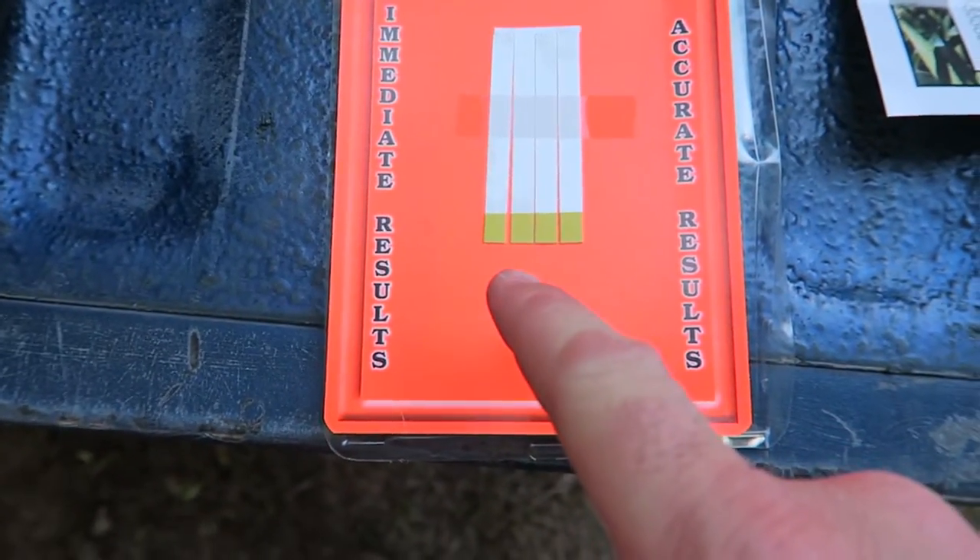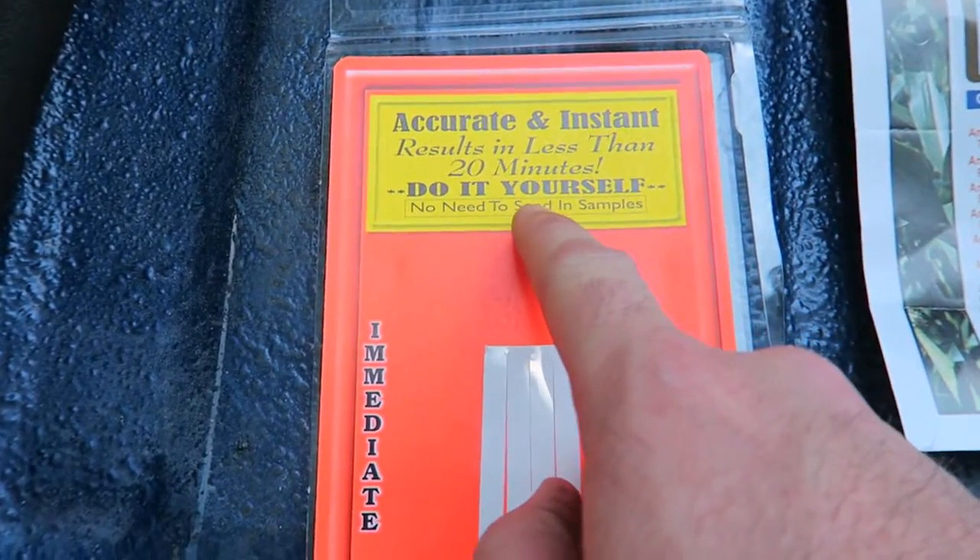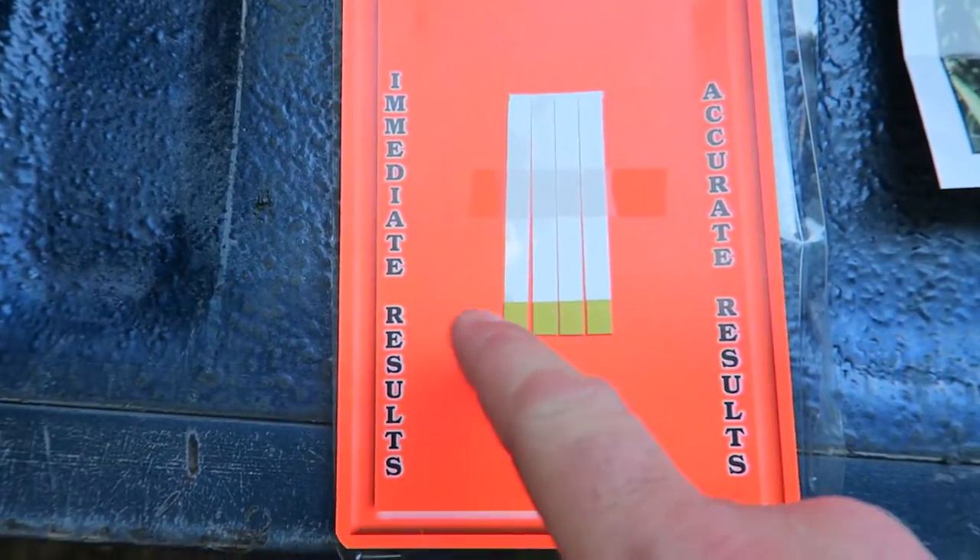This plot I tested back in February and it was 7.0, planted it and it turned out great. Then I had it tested again two to three weeks ago and it came back 6.9 — still perfect. So I'm going to run this test kit through with you guys, see what I get on the test strips. That way in the future if you're using the strips from Antler King and don't want to send soil to a lab, you can do this quick do-it-yourself thing.